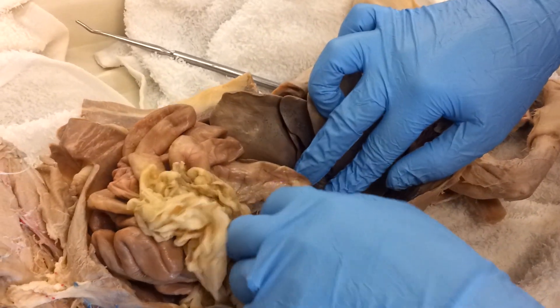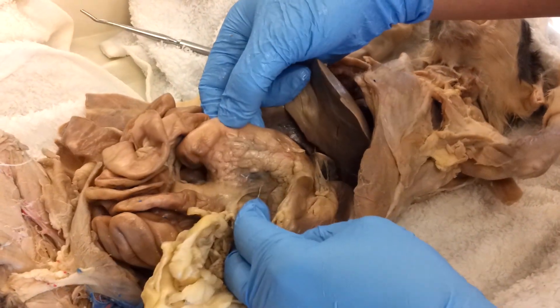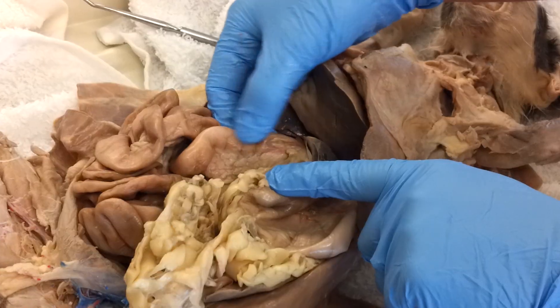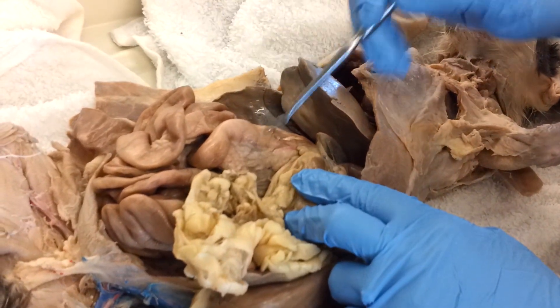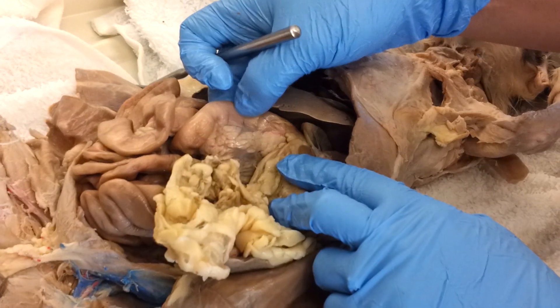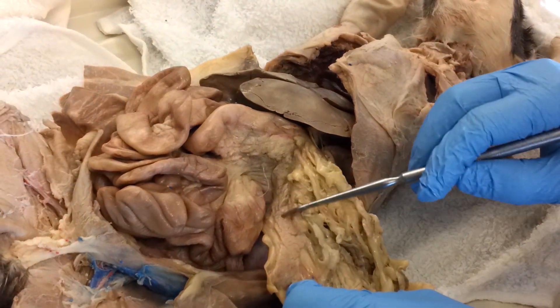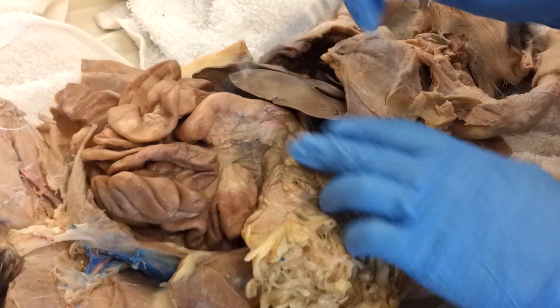At the end of the stomach starts the small intestine. The first curve of the small intestine is called the duodenum — this part of the small intestine. If you ever wonder where you're at, find the stomach and then keep following, and you'll know you're at the duodenum. Once you're at the duodenum it's very easy to find the pancreatic tissue. Here's some of it right here on the cat. The pancreatic tissue can be fairly diffuse, meaning you can find bits of pancreas all the way over here on the underside of the greater omentum.